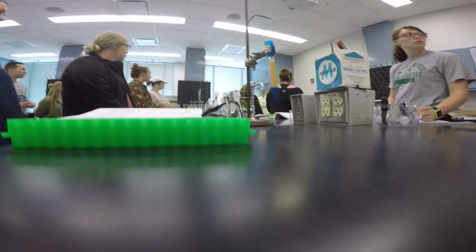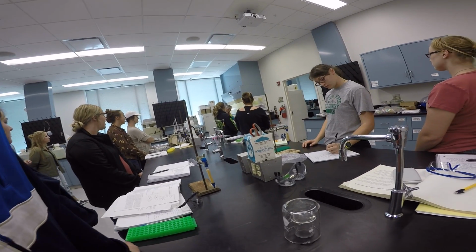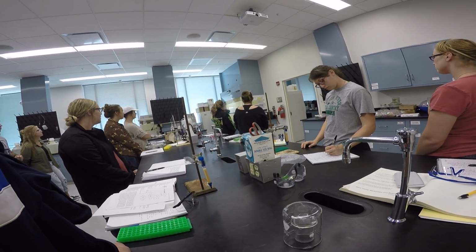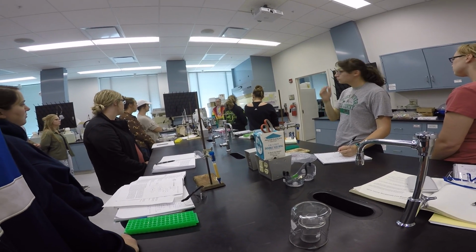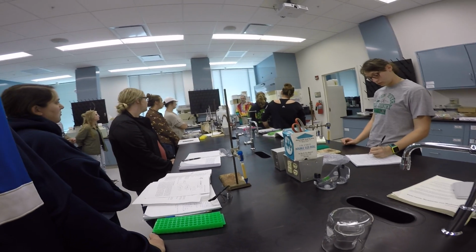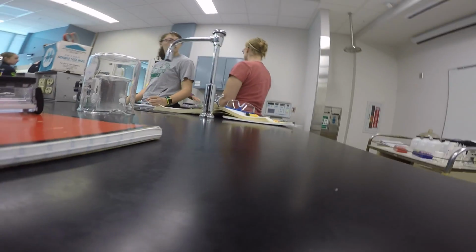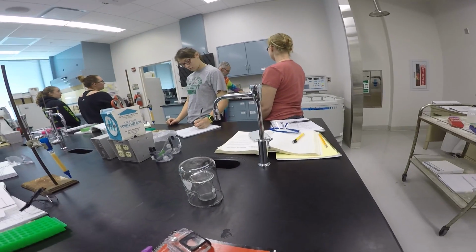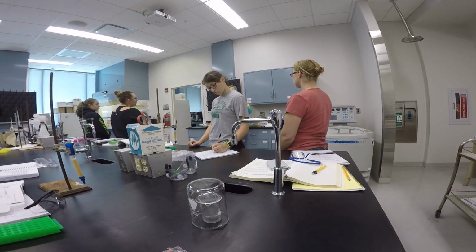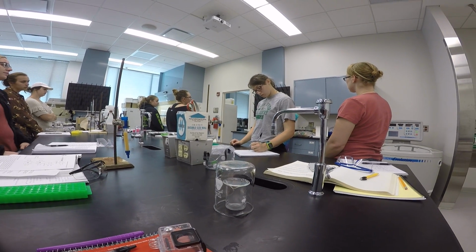What we'll do is pour it in this sprayer and bring it over here. What you're going to be doing is, with this, do all 15 of your samples at once. You can grab one of these pieces of filter paper and put a drop or two from each sample in a circle all around the outside: 1, 2, 3, 4, 5, 6, 7.